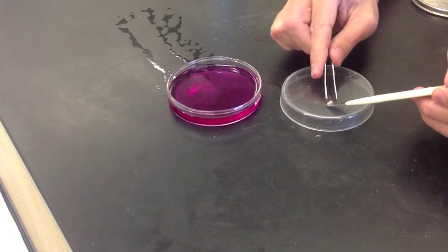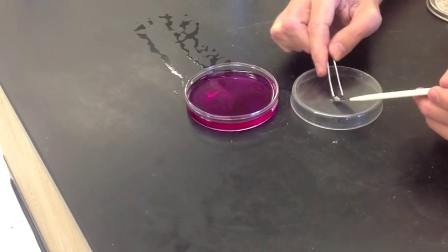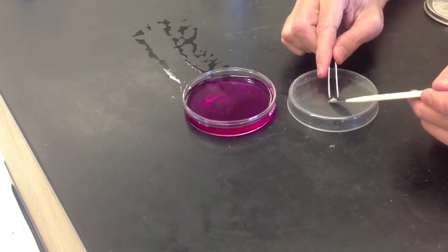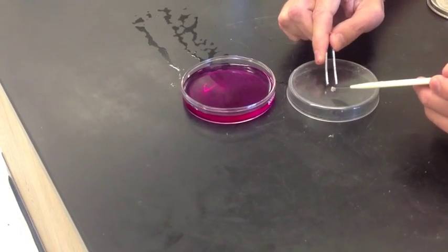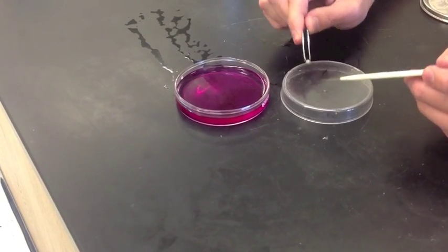And usually when I'm doing this in class, my students love to see it twice. Now, it's not going to get any pinker, but they like to see it rolling around on the surface of the liquid. So let's do it one more time. Here we go.